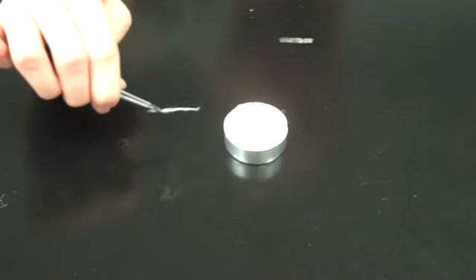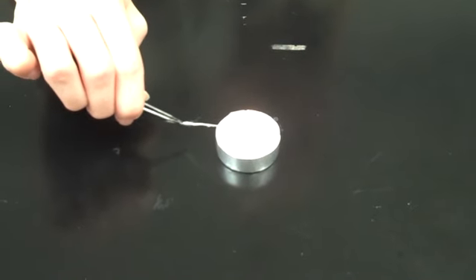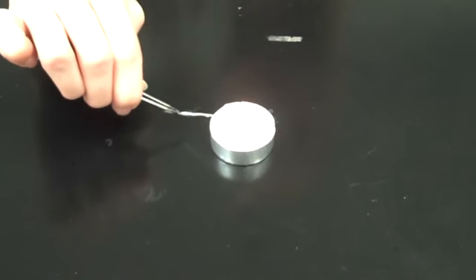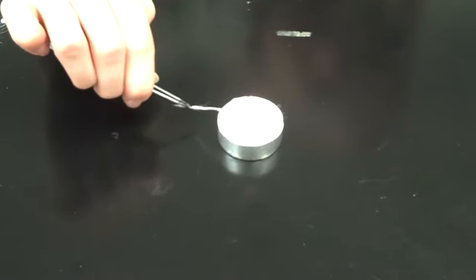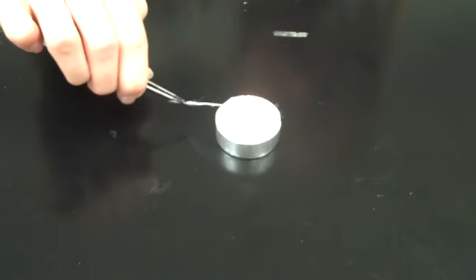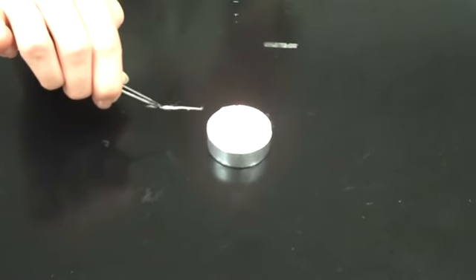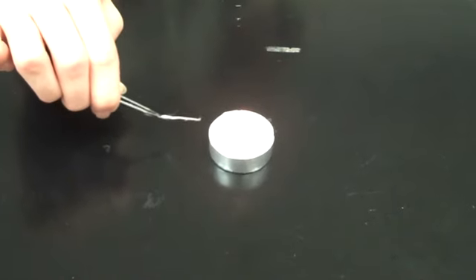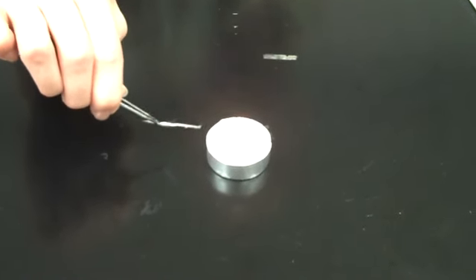You don't want to immediately stick your fibers in the flame, but you want to get them close and see if they shrink back from the flame. These fibers are not shrinking back. That lets me know that they are not synthetic; they are some kind of natural fiber, because the synthetic fibers should shrink back—all of the polymer-based ones.